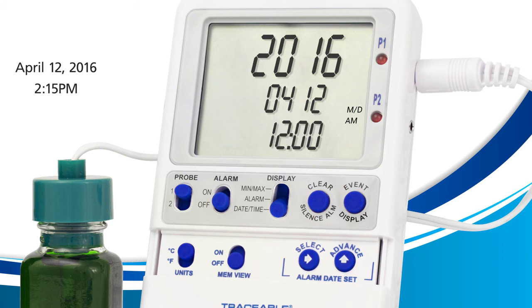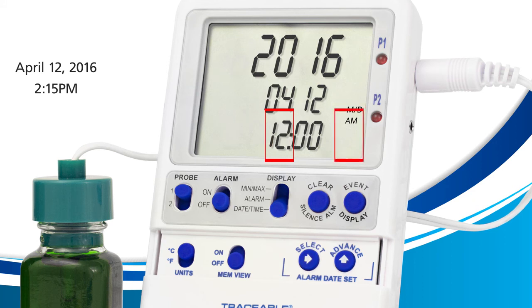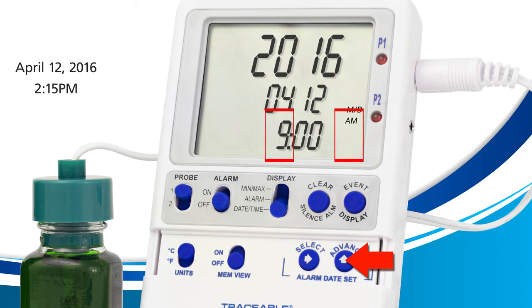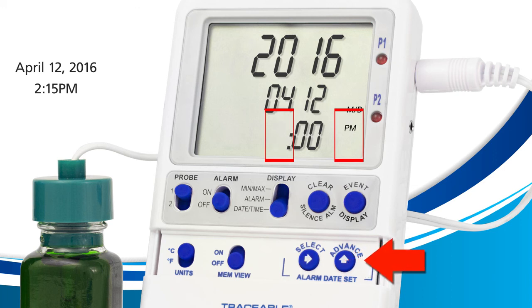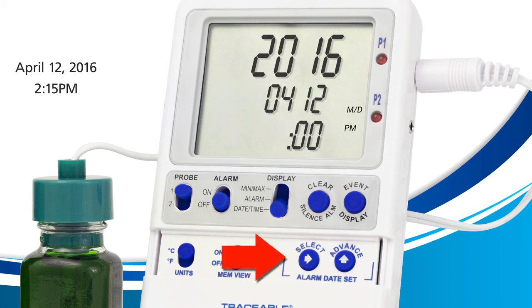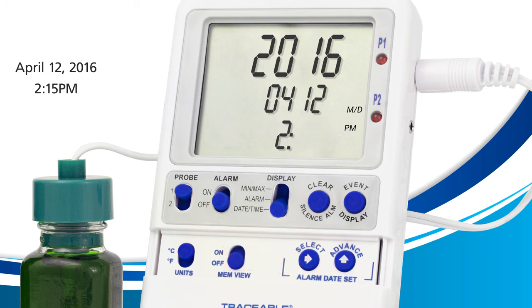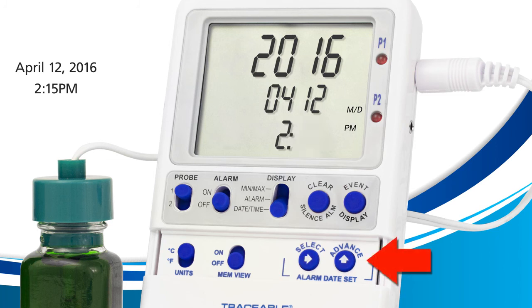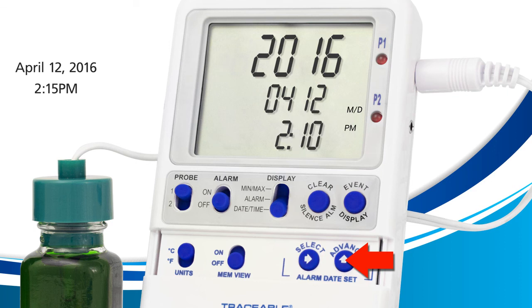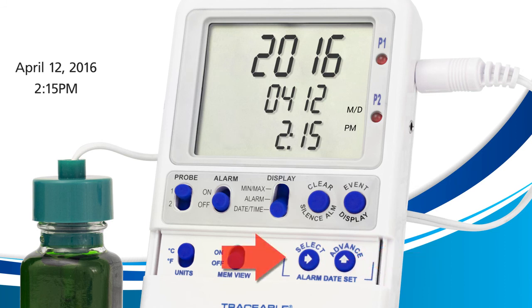Now we're on the hour field. Press the advance button until 2 is shown and PM is displayed. Once your hour is set, press select to move on to the minutes field. I want 15 minutes, so I'll press the advance button until I reach 15. Once you're at 15 minutes, press select to move on to the time format field.